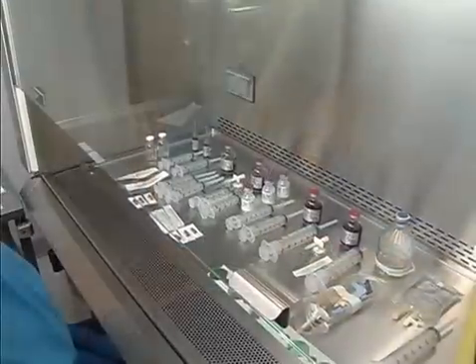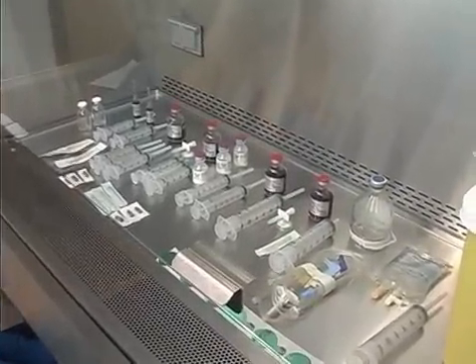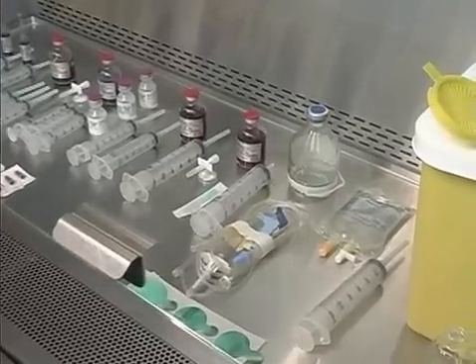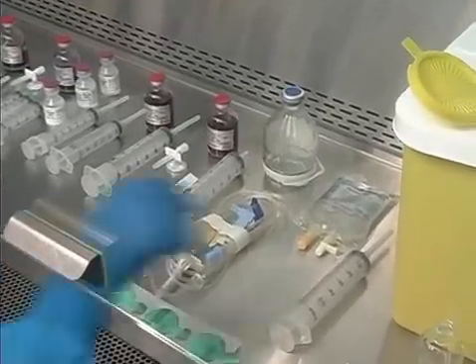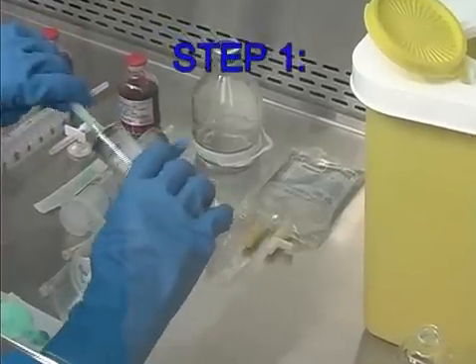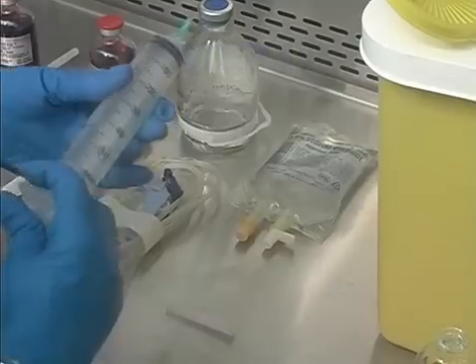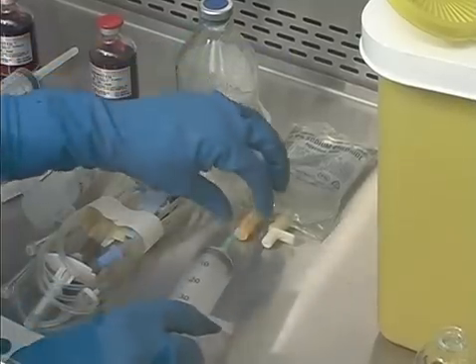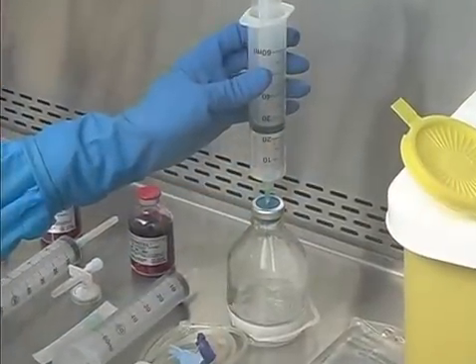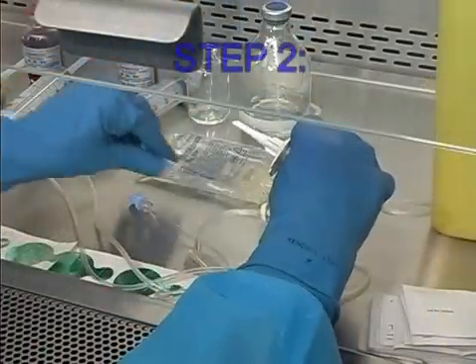Using the standardized hazardous drug compounding process and normal engineering and barrier controls, the exercise should be conducted as follows. Step 1: With a 60 ml syringe, transfer 50 ml's from the bag of normal saline to the empty evacuated container. Step 2: Attach an administration set to the bag as the final container.